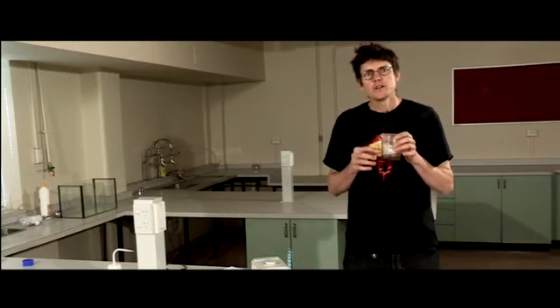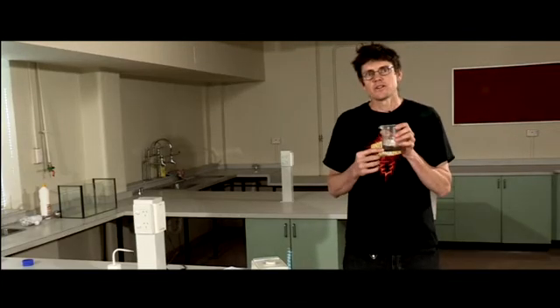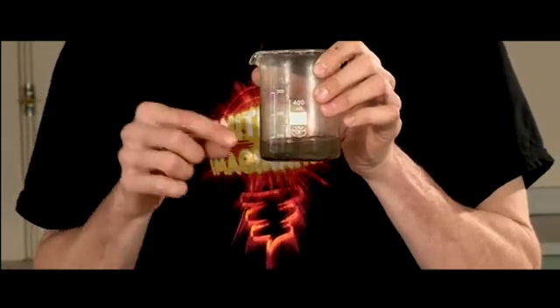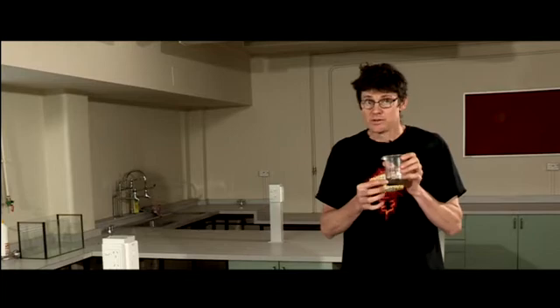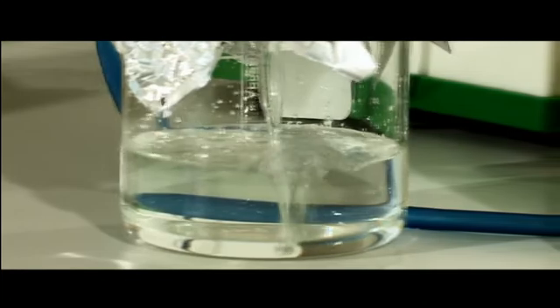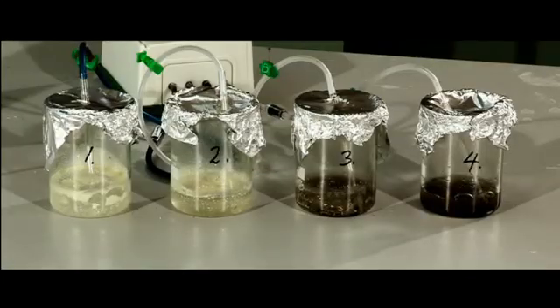A further test you could do: you could autoclave or sterilise half of each soil sample. This will kill the bacteria in the soil and will help you work out if the soil itself is actually playing a role. As is the nature of science, there are many more questions and answers that have come from this experiment. The microbial world is a fascinating one in which the myriad microbes play a vital role in sustaining the life of this planet.